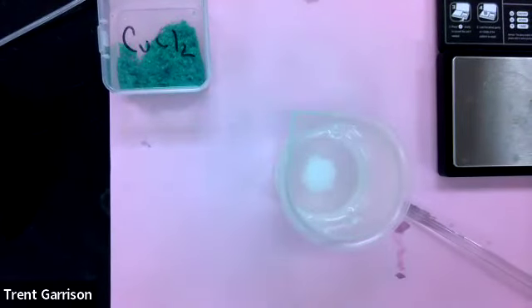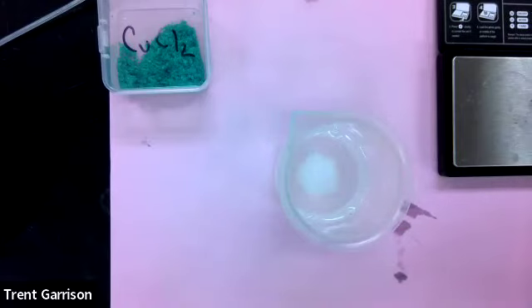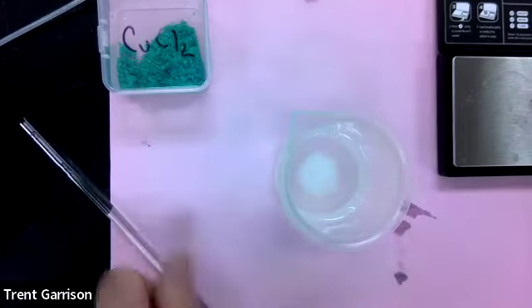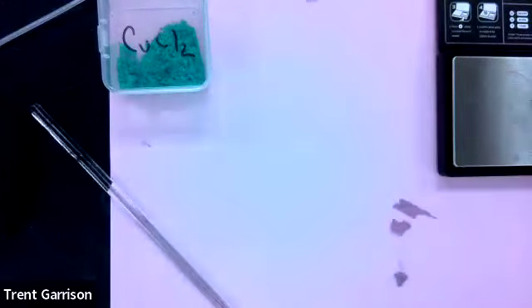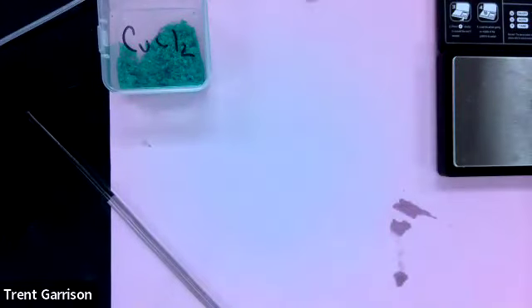That is an indication that no matter what we do, this is insoluble in water. So this is one of those polarity moments where it is not going to dissolve no matter what we do. Water and this material seem to have opposite polarities. They will not mix. All right, so we're going to dump this out, and then we're going to move to our second material, which is the green.